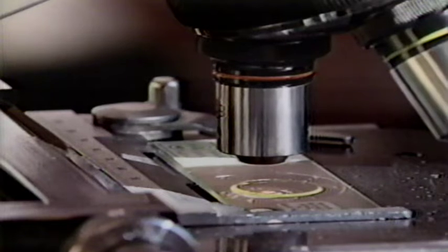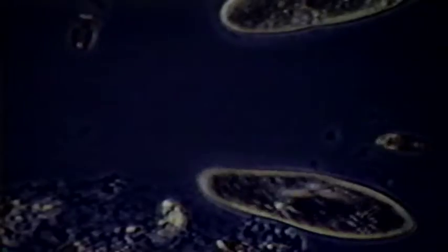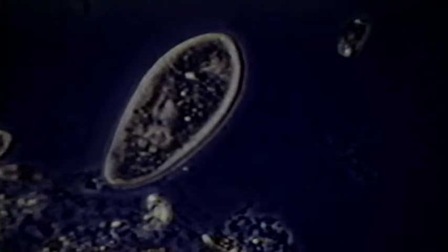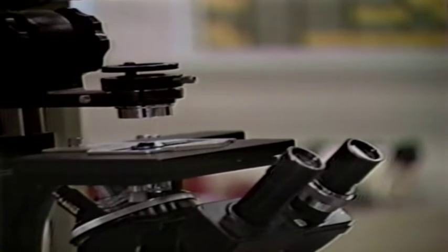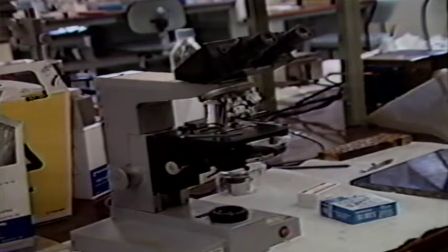These specimens are magnified first by a small objective lens, which is the lens closest to the object, and then by another lens in the eyepiece, which results in a much larger size image being projected on the retina of the eye. There are hundreds of styles of compound microscopes. All provide a means of obtaining bright, enlarged images of sample material, and all share the same basic components.